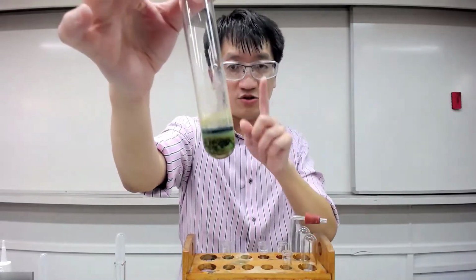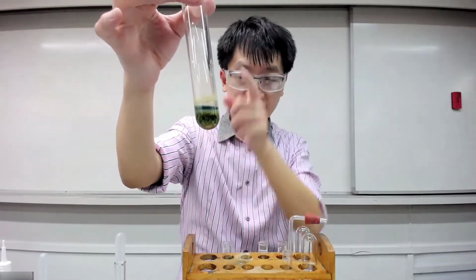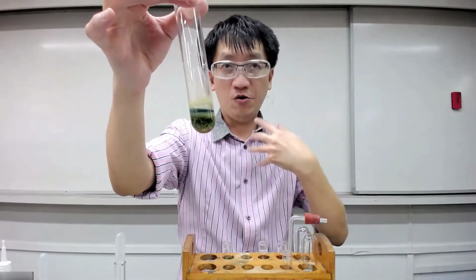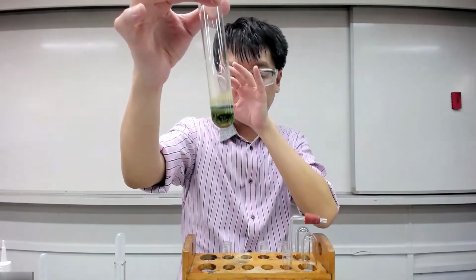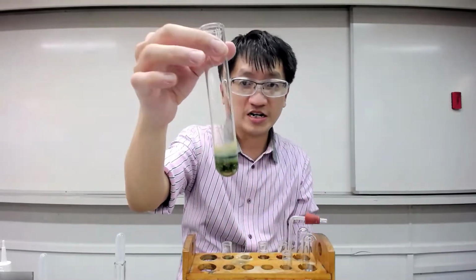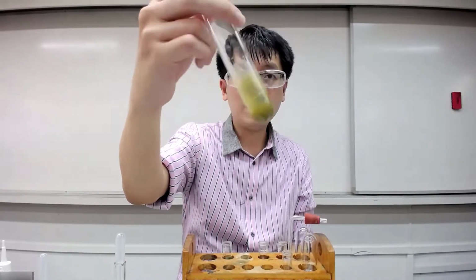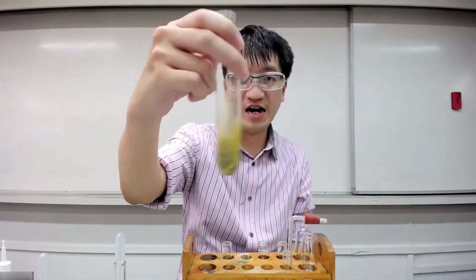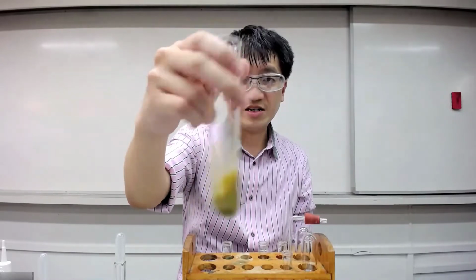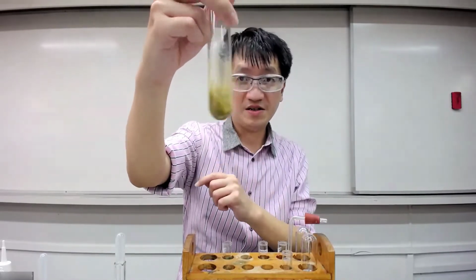But you shouldn't be recording this. This is for you, for your own checkpoint, to check what it is likely to be. What you should be recording is you swirl this solution. Remember two kinds of swirl. One is the very hard one, the other one is like okay. You should be recording this.